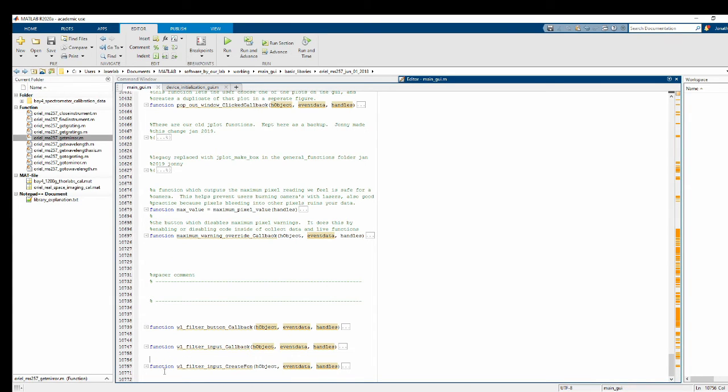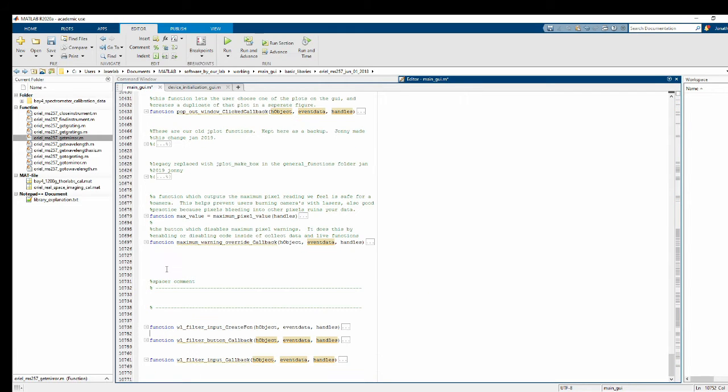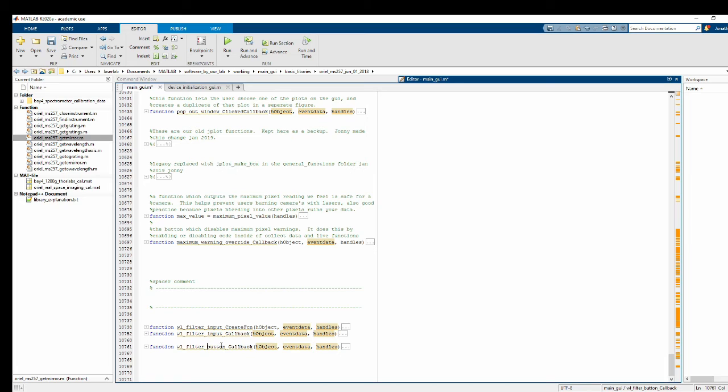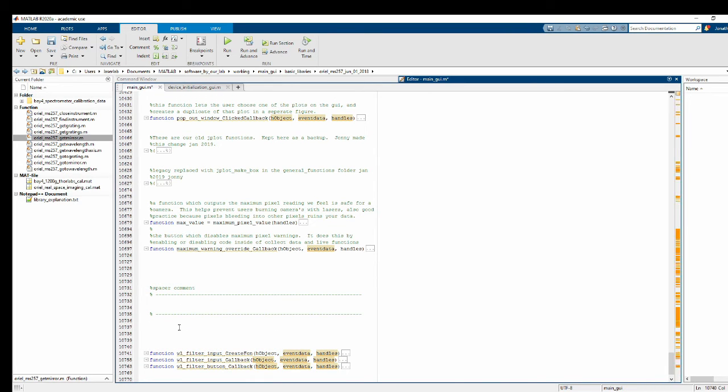Alright, so again, the input function, when we actually type in that field, it's never going to do anything. So this one is the least important to us. And then the creation function is also pretty irrelevant. So the only one we're actually going to add code to is the callback when you press the button. Let's go ahead and put some comments on this. White light filter controls.